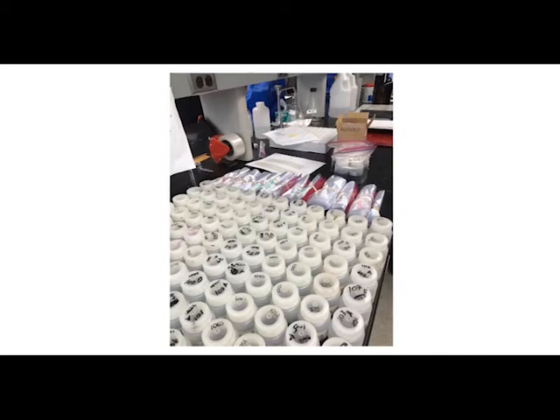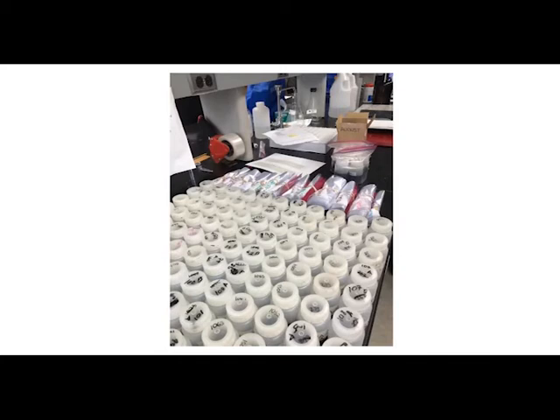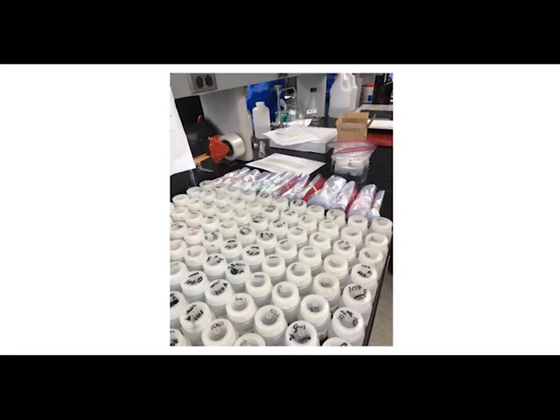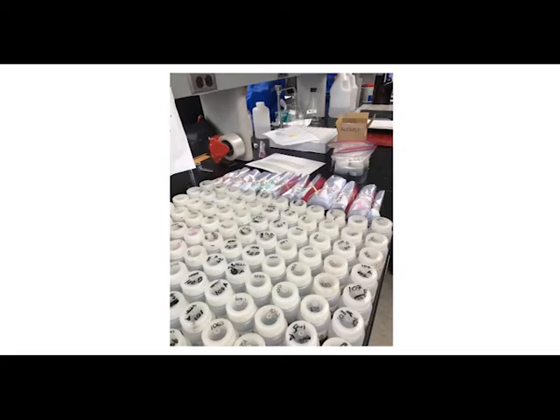What you're looking at here are samples — each bottle is a sample from a hive, and it contains bees. It's kind of equivalent to a blood sample your doctor would take from you. Each one of these bottles only has a couple hundred bees, which may sound like a lot. But when you're talking about a colony that has 10,000 bees, it's really just a drop in the bucket.